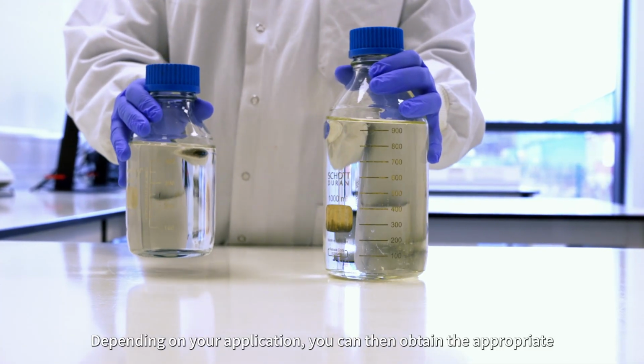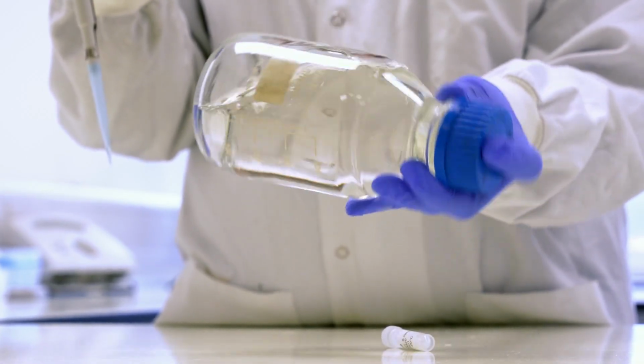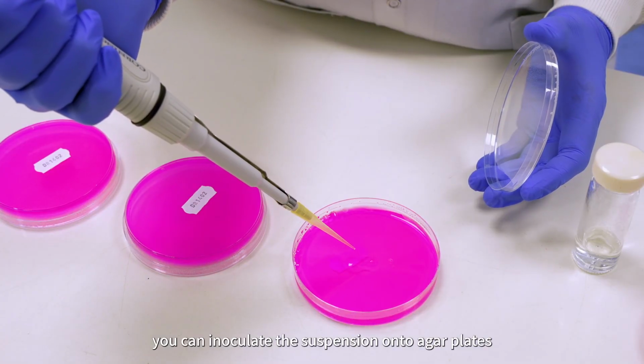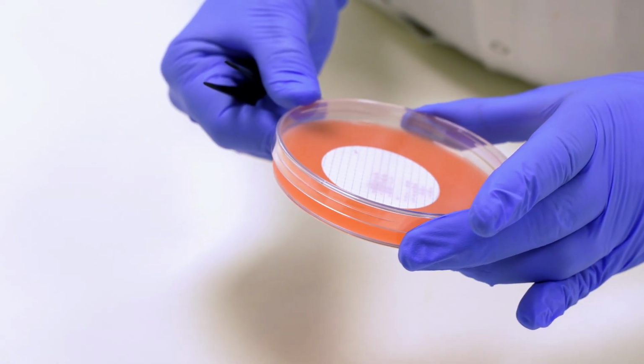Depending on your application, you can then obtain the appropriate microorganism count by adding whatever quantity of diluent you wish. Once you have the volume and concentration that you want, you can inoculate the suspension onto agar plates or use membrane filtration to test the sample.